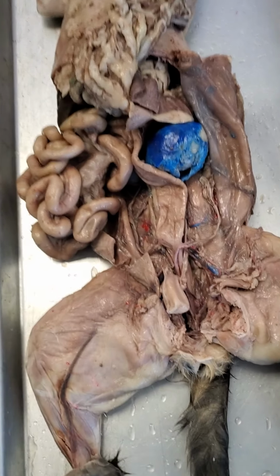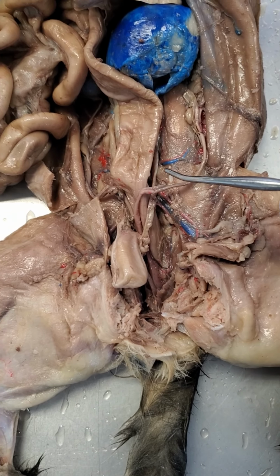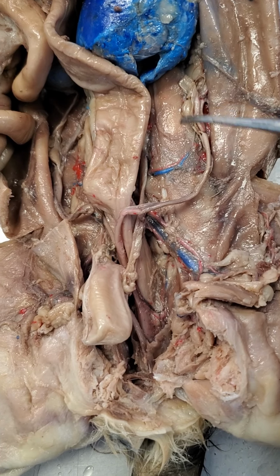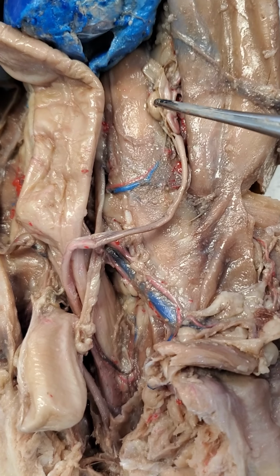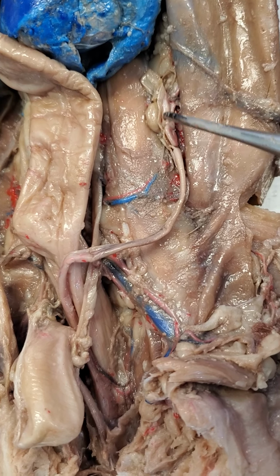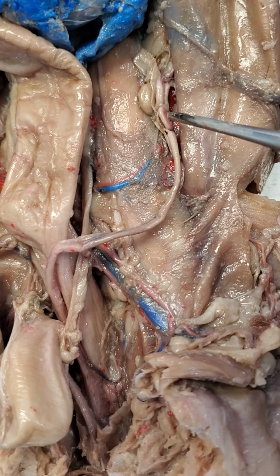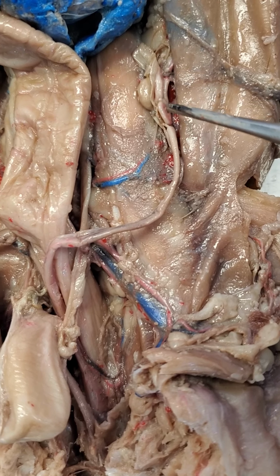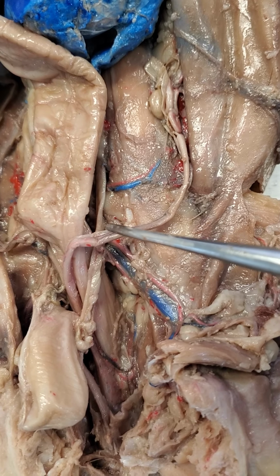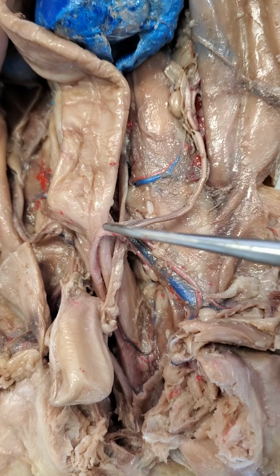All right, so let's go back to the female anatomy. So we can identify a number of structures that we can see in the female. One thing we can do is start at the top and work our way down. So like we mentioned, this right here is a really clear view of an ovary. All right, so that is the left ovary. And you can actually see right here that I'm tracing this fallopian tube. And the structure right here leading down from that fallopian tube is going to be a uterine horn. So this is all an extension of the uterus of the cat.